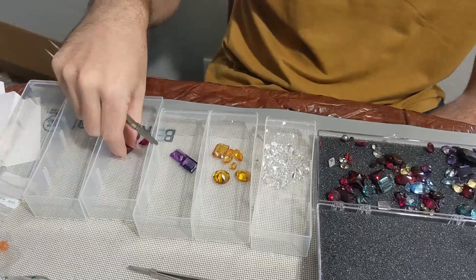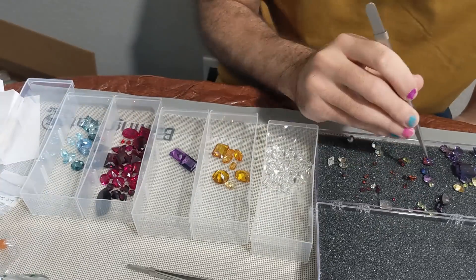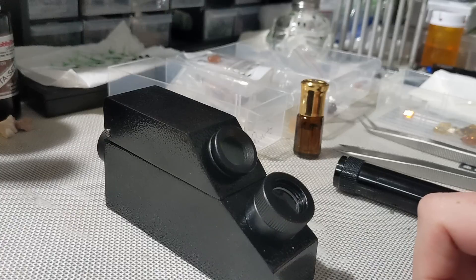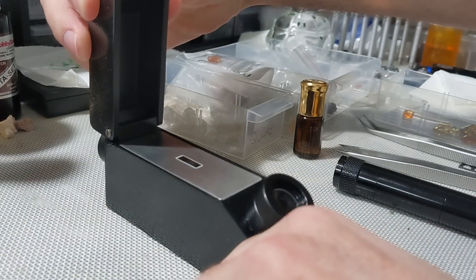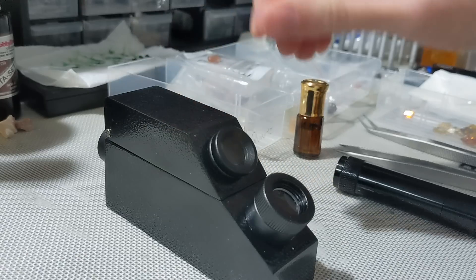The clears are exclusively cubic zirconia, and I could make an educated guess about several of the others, but sometimes gemstones are tricksy little hobbitses, which is why I'm glad to have a gemstone refractometer now. This is a wicked basic model, like $70 all in, so the caveats here are I only have a little idea of what I'm doing and I don't know how this compares to the nicer models.